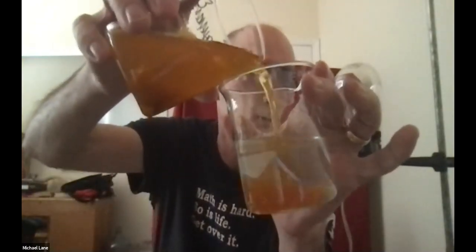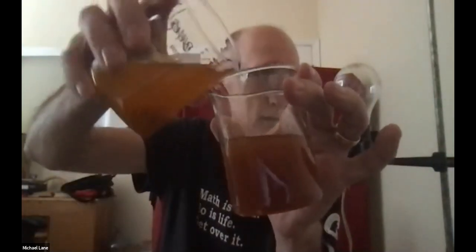So let me get that in an appropriate location. Side. There we go. So on 3, 1, 2, 3. Right. And you can see the solid formation in there. It doesn't show quite as good as I'd like. Let me hold it up real close to the camera. And I think you can see, let me see if I can get some light in here that might help a little bit. But you can see there, it's beginning to settle out already, right? The solid is getting there, and I'm going to hold that there for a moment. Actually, maybe I'll come back to it. So I'm just going to let that sit there for a while.